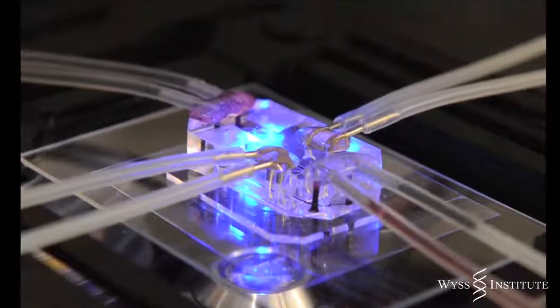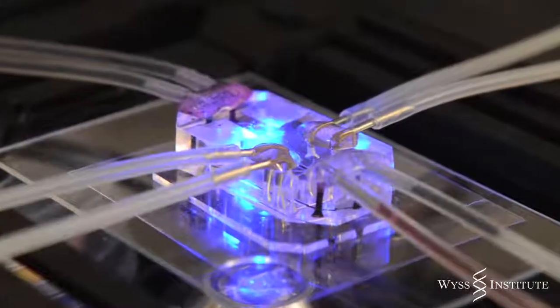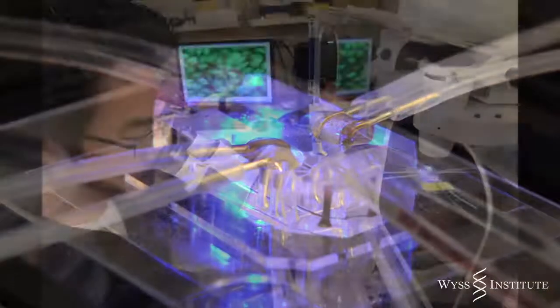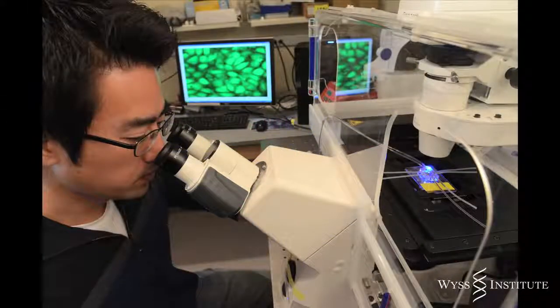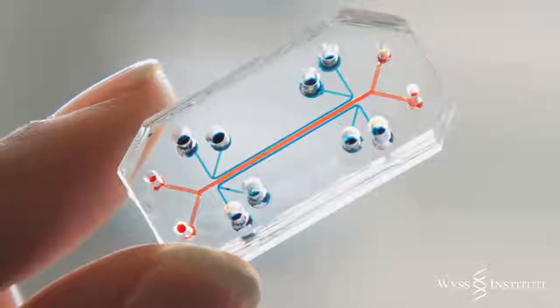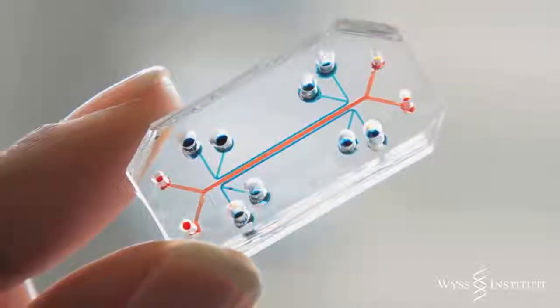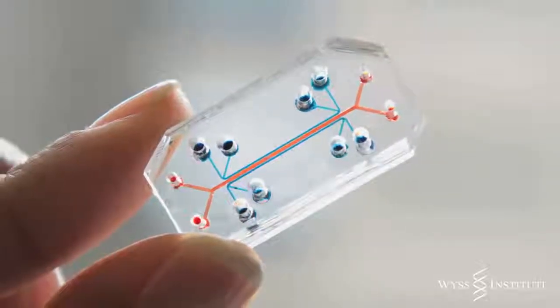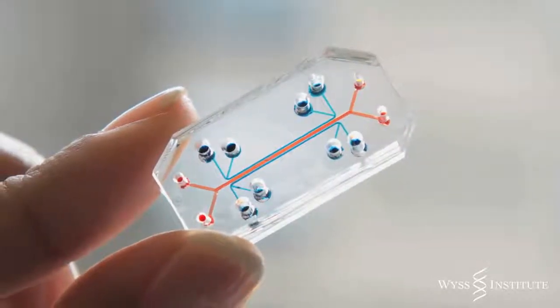The lung on a chip can also mimic the toxic effects of airborne nanoparticles on the lung. In fact, experiments with the device led to the prediction that breathing increases their absorption into the bloodstream, and this has been confirmed in animal studies. Bio-inspired microdevices that can mimic whole human organ function, such as the lung on a chip, could potentially replace animal testing and bring new therapies to patients faster and at lower cost in the future.